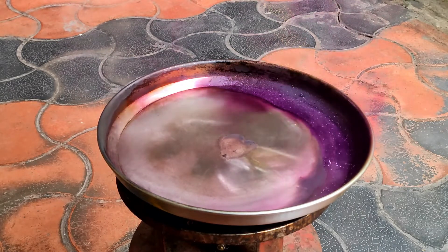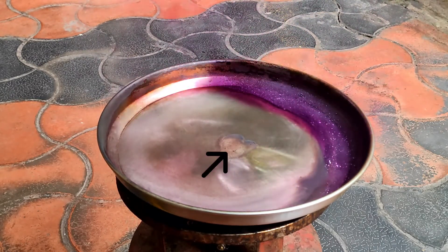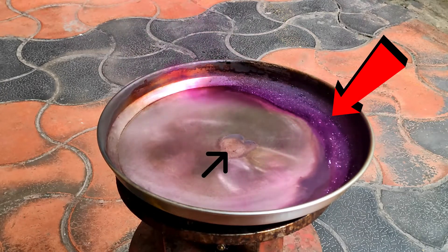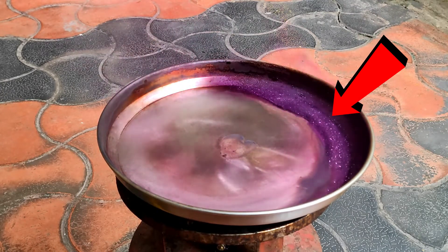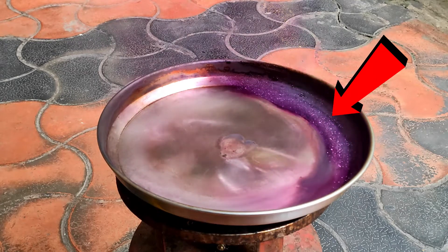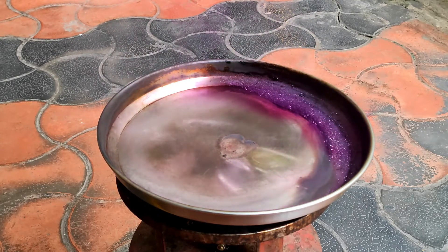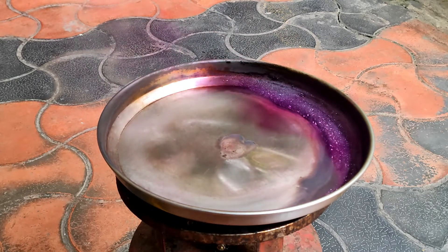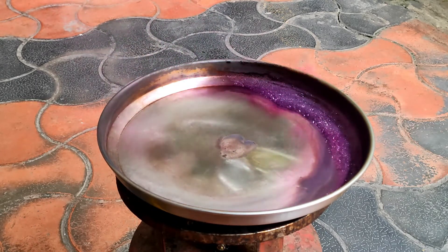As you can see, iodine has completely sublimated from here and part of it is deposited on the outer surface of the plate. The reverse of sublimation is called deposition, a process in which a gaseous substance condenses directly to the solid state.